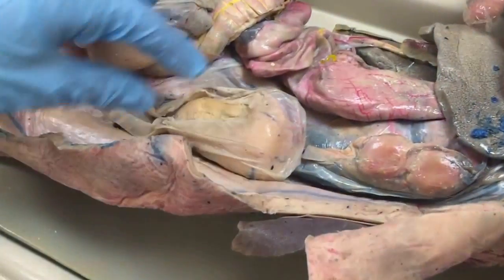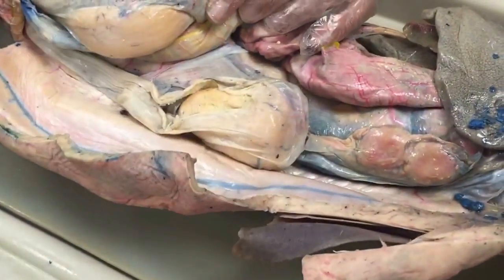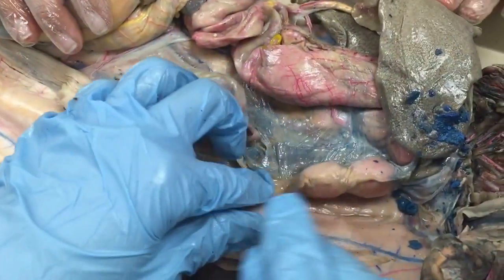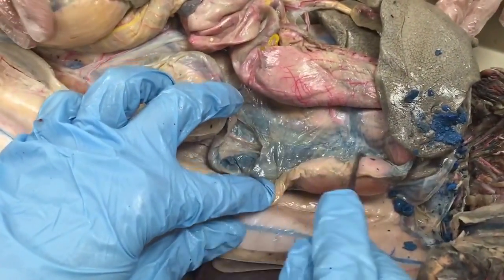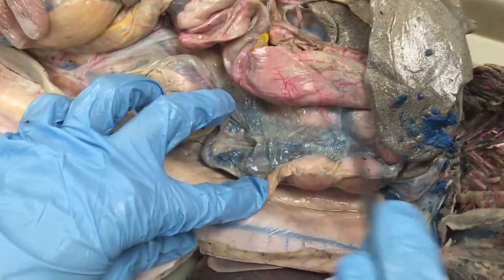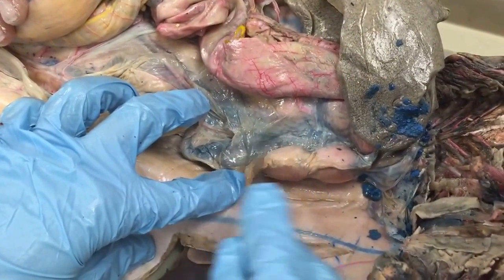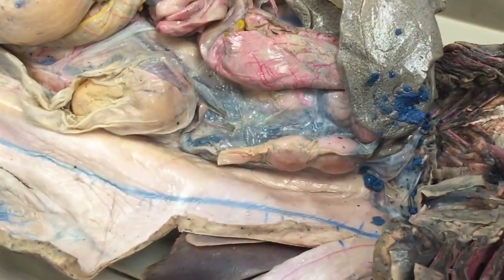So that's all for the female. You guys can cut through and look at the mesentery of the ovary. The mesentery of the ovary is the mesovarium. In a male, it's the mesorchium. It's a little bit easier to remember in the female because it sounds like mesovarium.